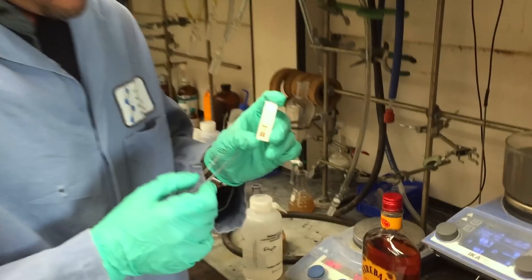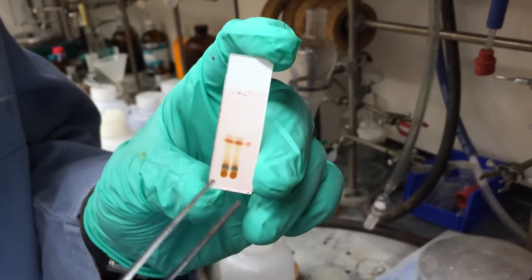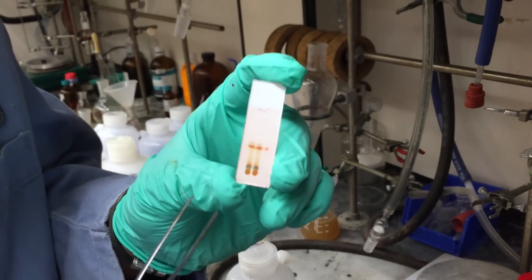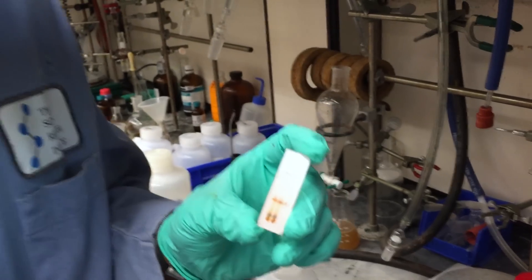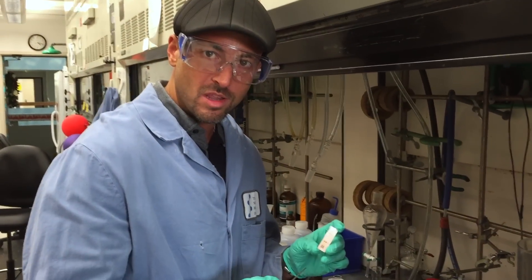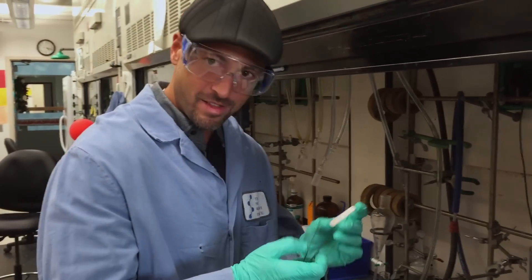Okay, so guys, here's the TLC. You see it's a little bit messy, but I mean, who knows what that is? Could be something from the whiskey. But there you go. It's authentic product. We will purify it, get an NMR, make sure it is a product, but it sure does look like it. Okay, that's it folks.